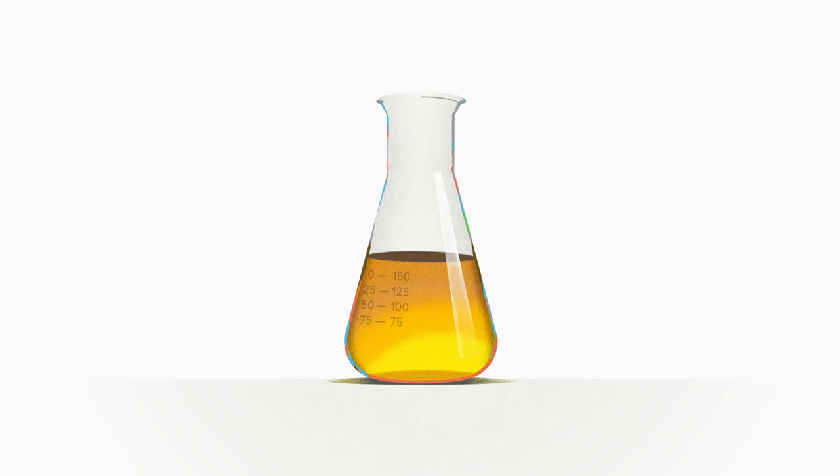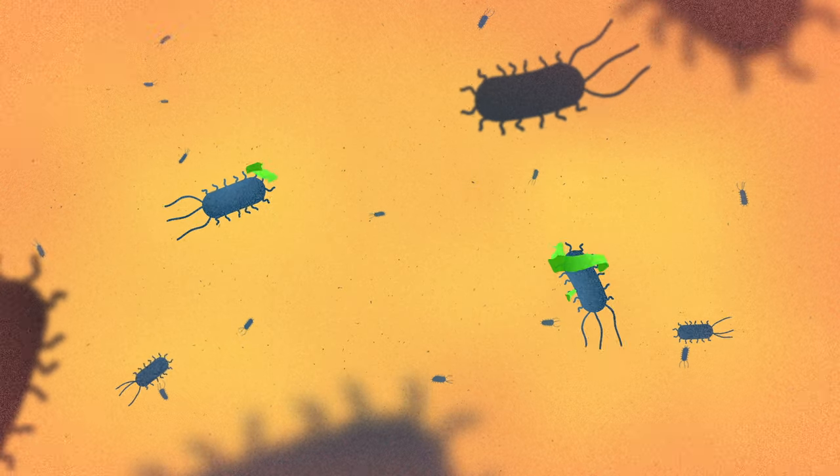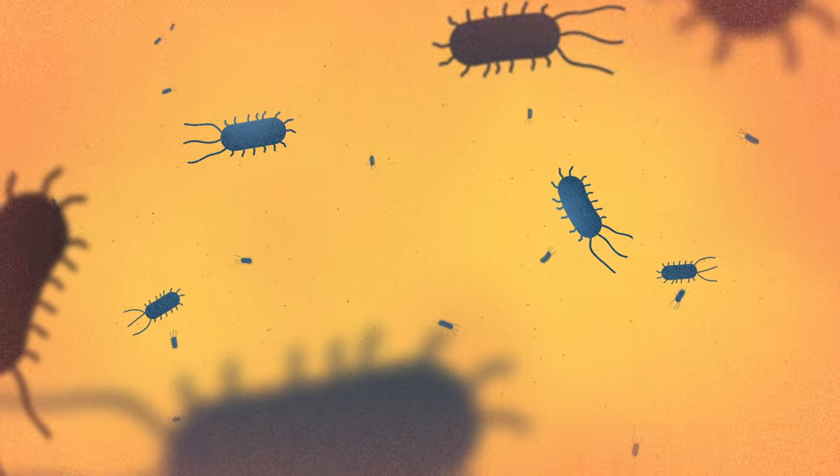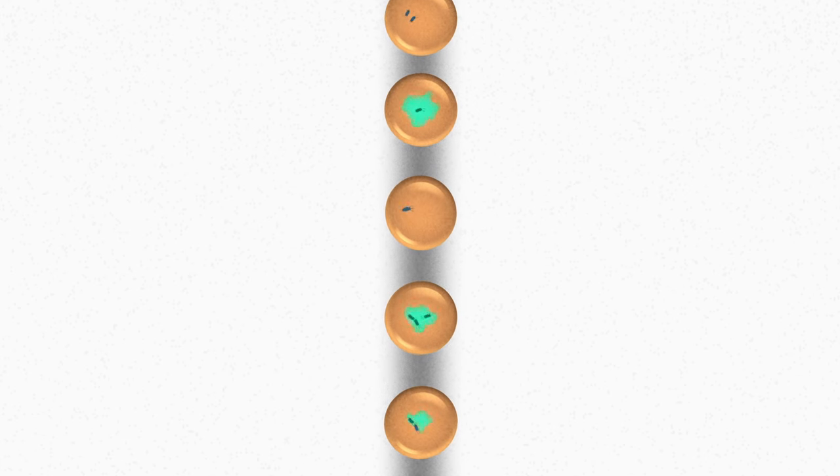Here's how it works. We start with a microbial culture. We use natural mutagenesis or some other strategy to create diversity in the population. Then we encapsulate the microbes into tiny little hydrogel beads — we call them nanoliter-scale bioreactors. You can think of them as very small test tubes. Each hydrogel bead includes a little bit of media and a little bit of room to grow. As the microbes grow in these nanoliter-scale bioreactors, they can secrete proteins or make fermentation products, all of which are captured inside the bead.